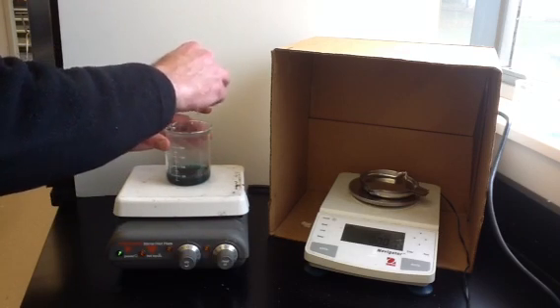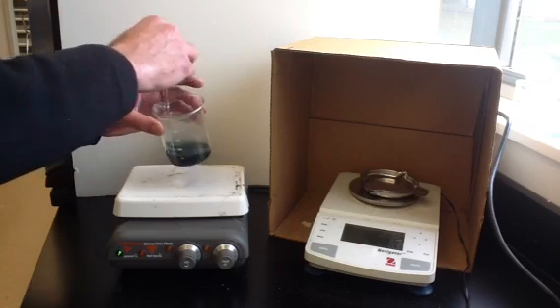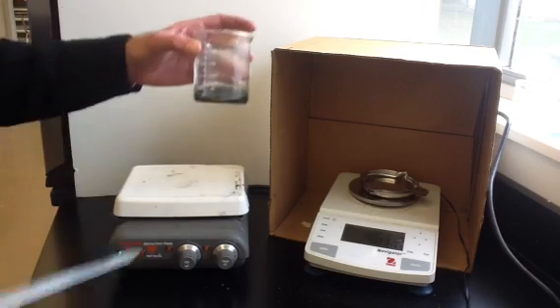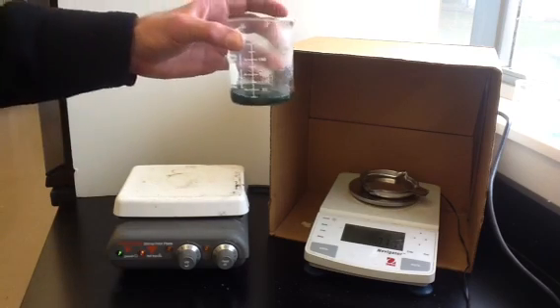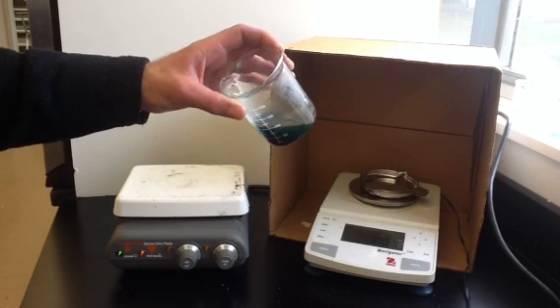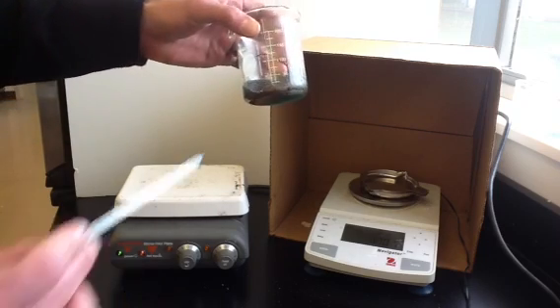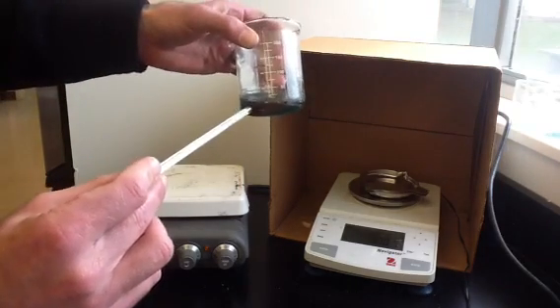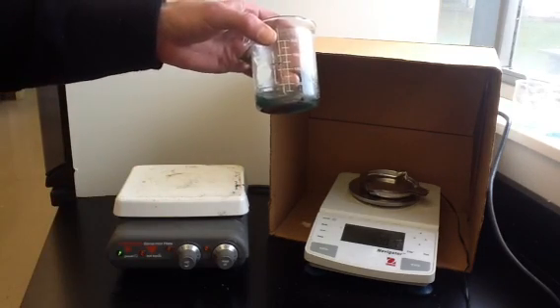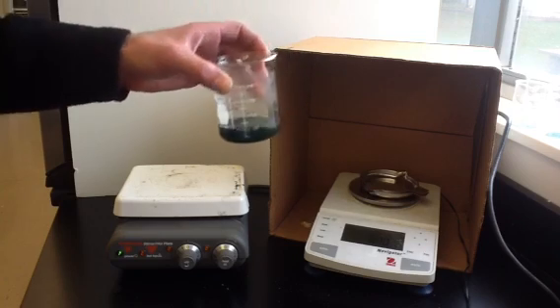We had copper sulfate in excess, so the solution still has some of the blue copper sulfate color. But down at the bottom, you can see that the material being produced is more of a copper color than the color of iron.